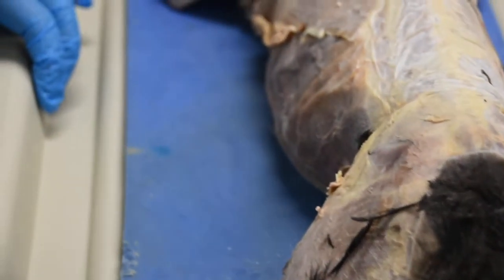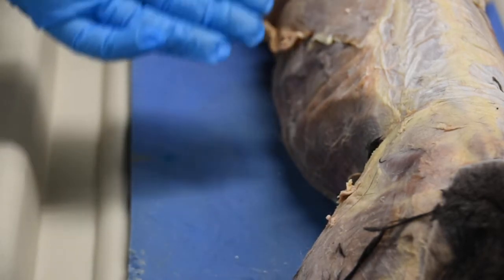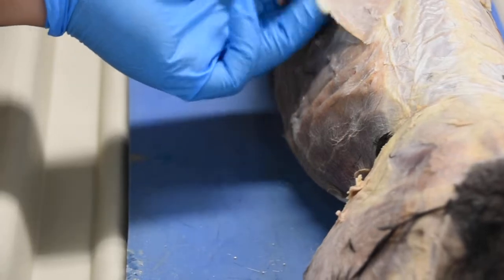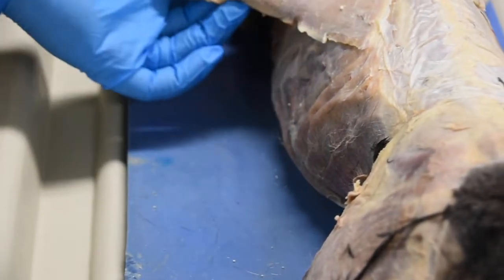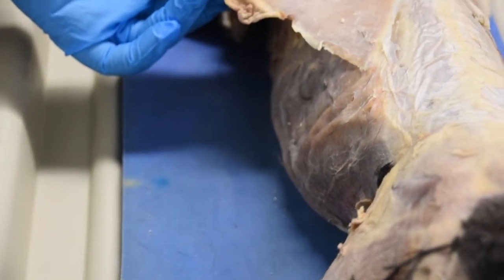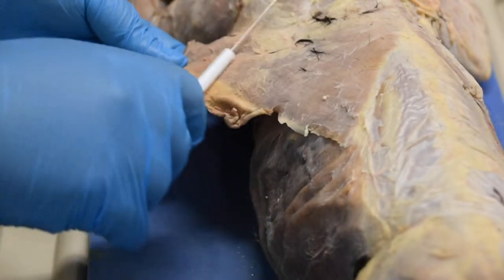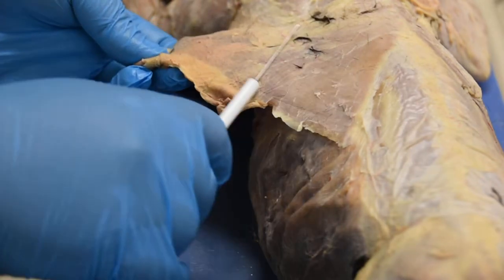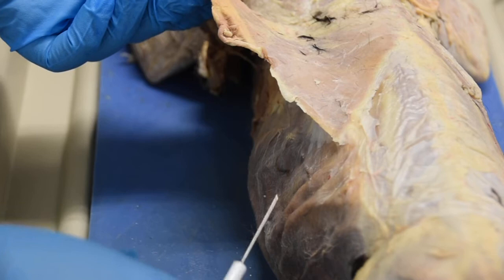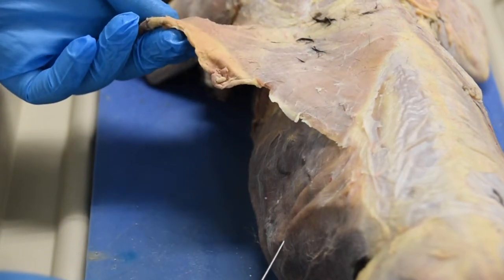Going farther up, so we're kind of working backward now, you have this muscle right here. You can see this sheet of muscle that starts from the back, and you see that it's going underneath the armpit. This is your muscle called latissimus dorsi. Not to be mistaken with this one we see right here, which are your external obliques.